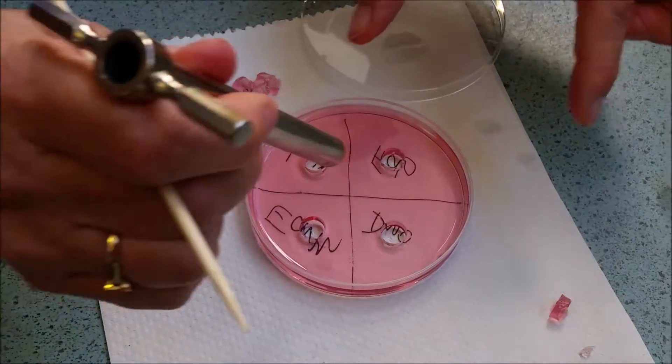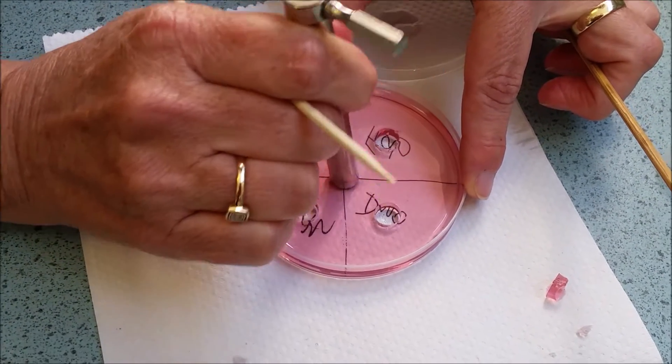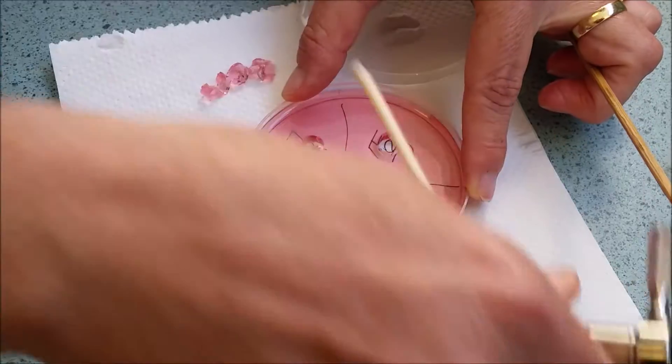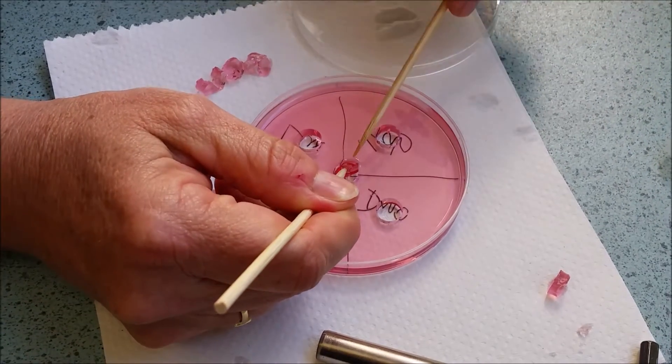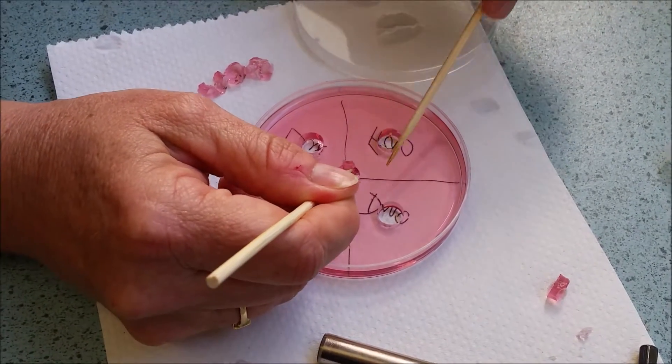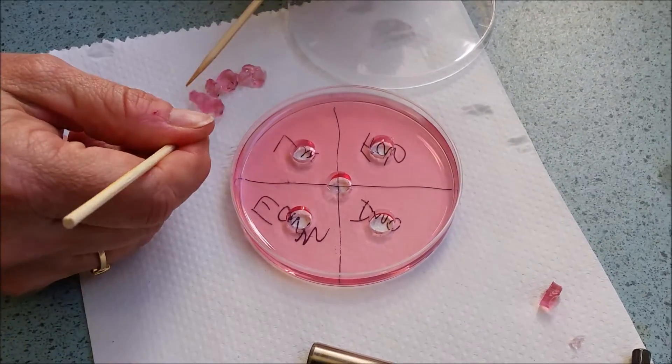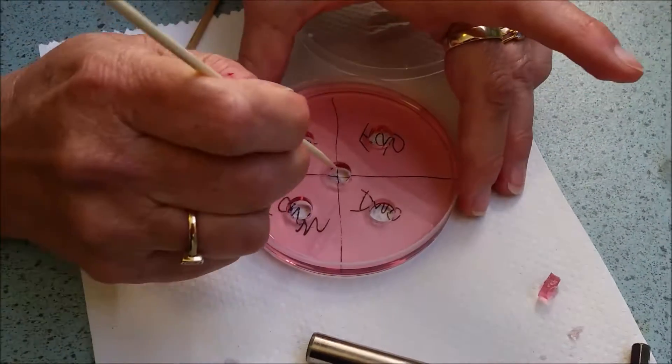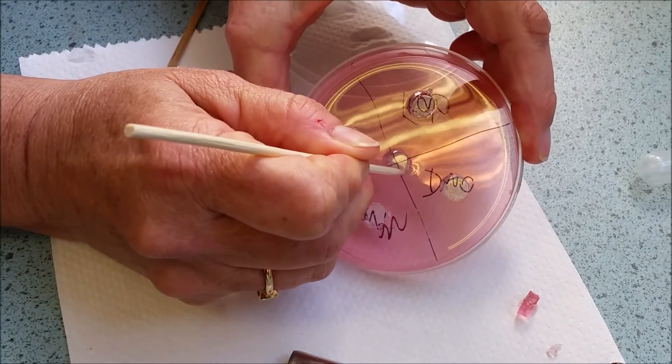And then one down the middle where the two lines dissect and you can discuss why we would be doing that. This one needed a little bit extra cleaning around.